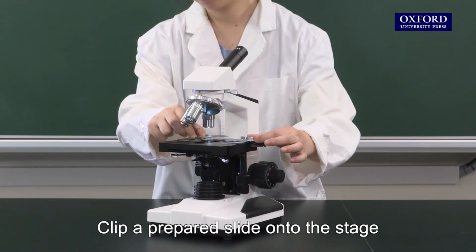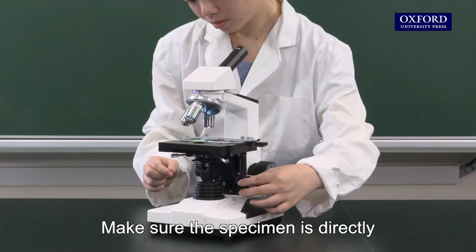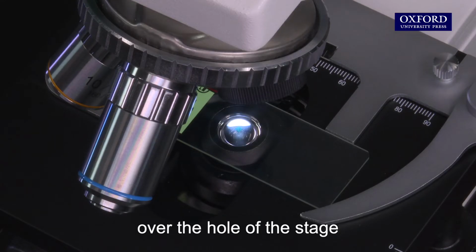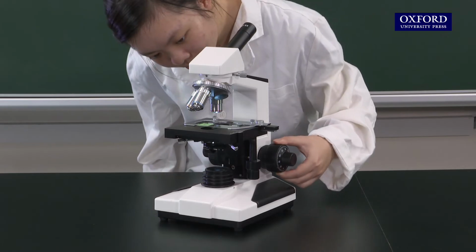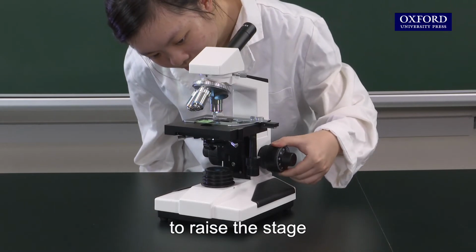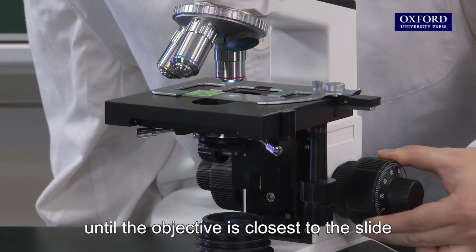Clip a prepared slide onto the stage. Make sure the specimen is directly over the hole of the stage. Watch the stage from the side. Turn the coarse adjustment knob to raise the stage until the objective is closest to the slide.